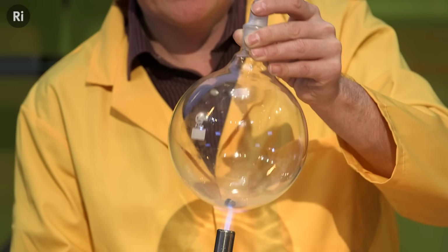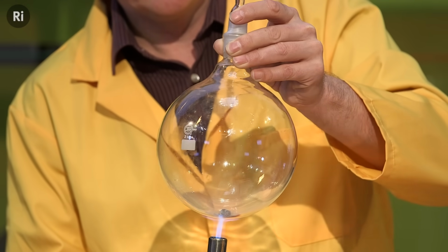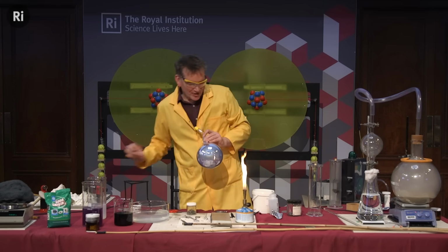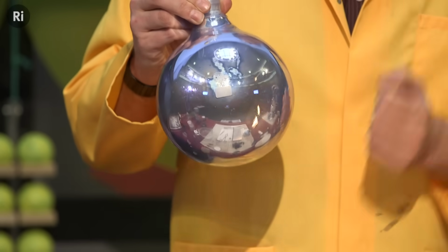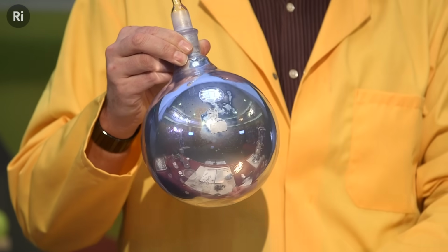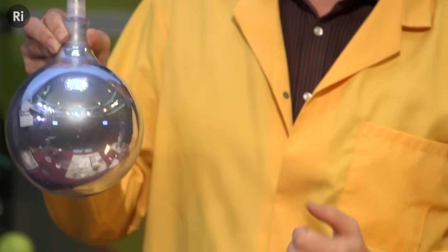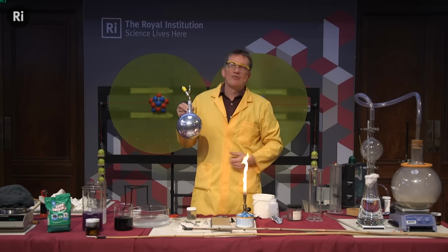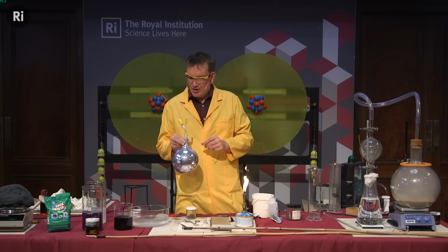So if I heat this up, which is quite fun. So this has now made a potassium mirror. Because it's quite easy to separate the atoms, just by heating this lump of metal up, it easily boils and turns into potassium gas, which is now condensed on the cold flask. There's nothing for it to react with, okay? So it instantly just coats the whole of the flask with this beautiful potassium mirror. If there was something for it to react with, it would react.